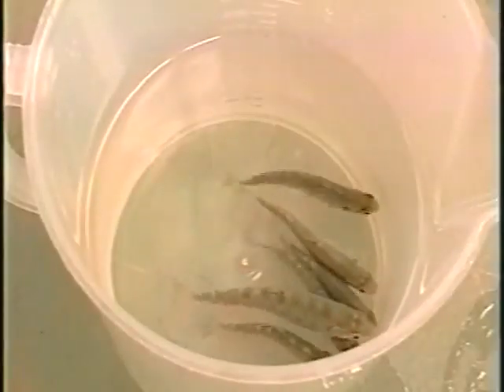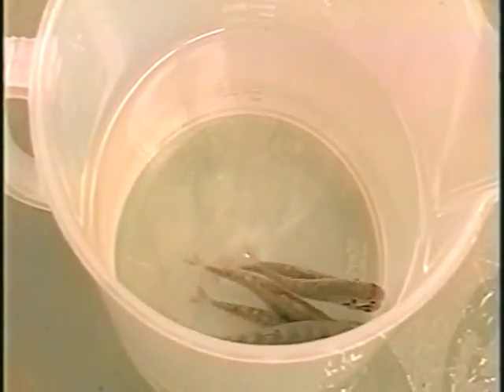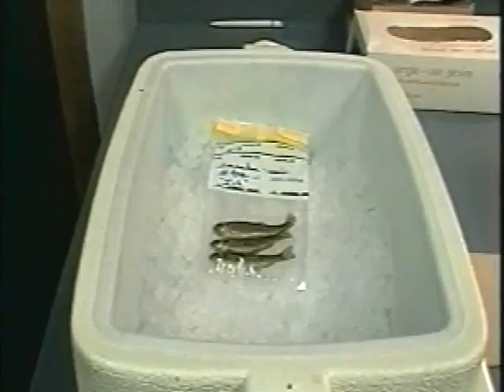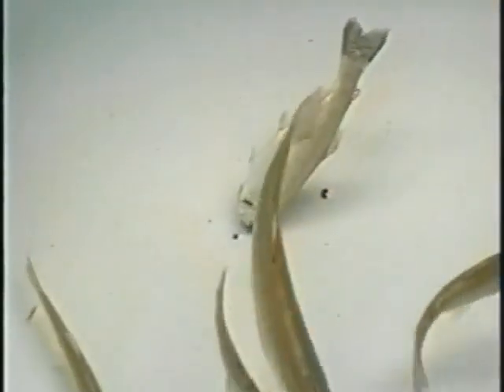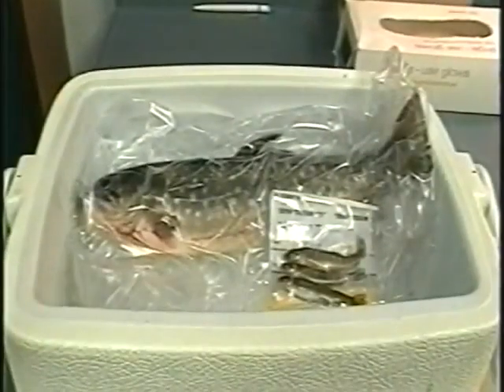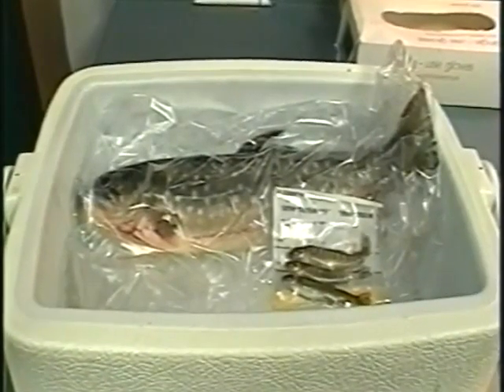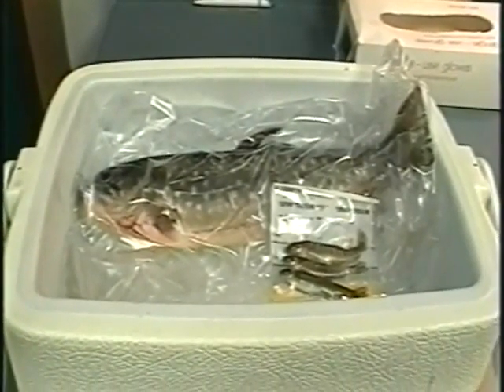Proper identification of most fish parasites depends on measurements and characteristics of live specimens. Therefore, it is preferable to examine live fish. If this is not possible, fish should be freshly killed and packed on ice. However, following death of the host, certain parasites may exhibit morphological changes or may migrate from their site of infection, and external parasites may detach from the dead host. Freezing is not recommended. However, frozen samples are acceptable for diagnosis of certain spore-forming parasites.